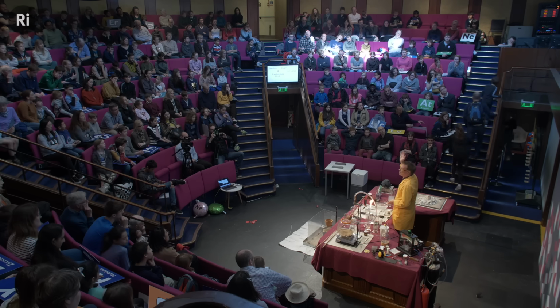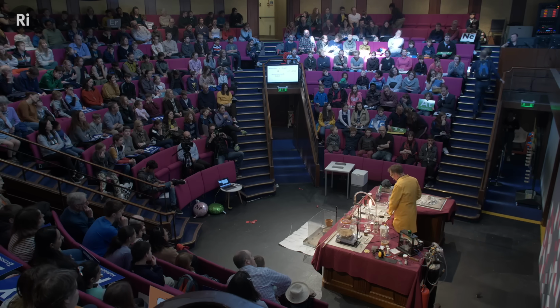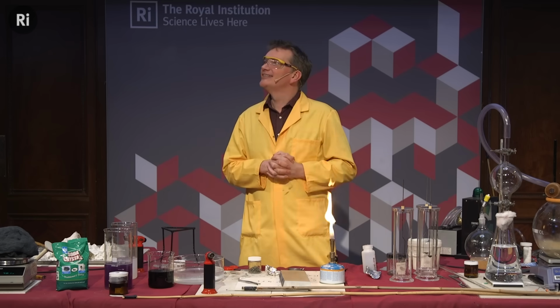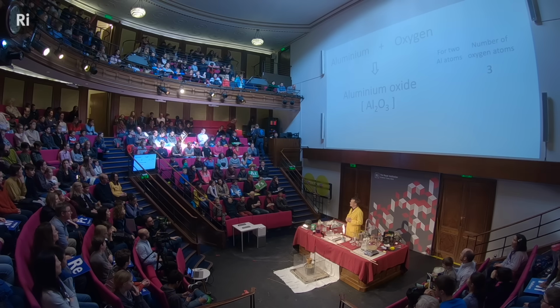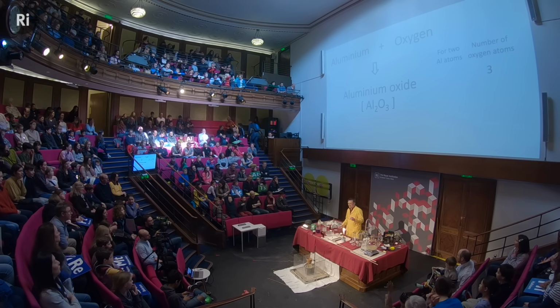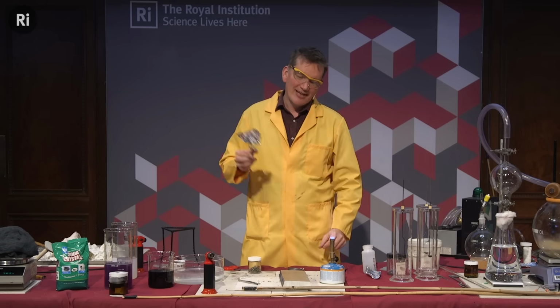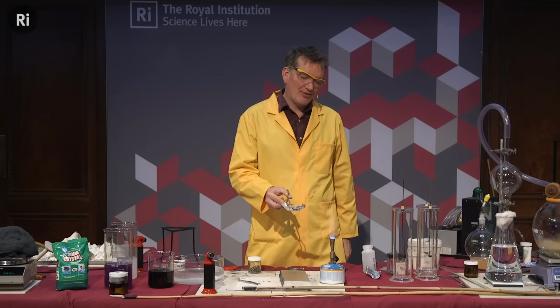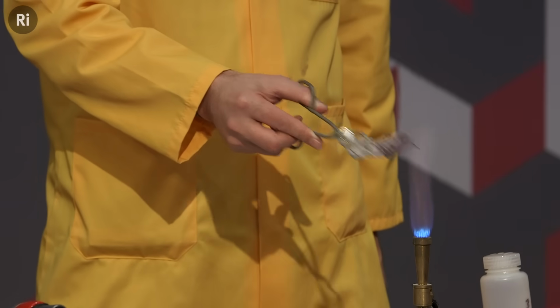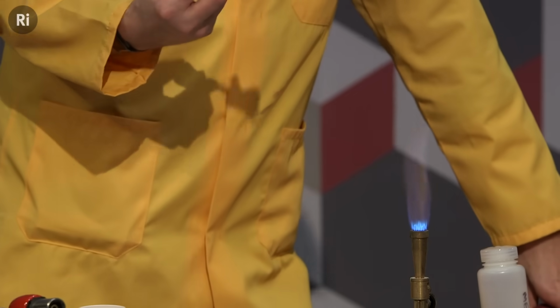So we have boron at the top, and underneath boron we have aluminium. Can we do the same thing with aluminium? So I have some aluminium. Now, who thinks the aluminium is going to burn very easily? Who thinks it's not going to burn very easily? Well, let's try. So I have some aluminium foil. Well, of course, it doesn't burst into flames. We wrap our turkeys with this when we put them into the oven. Well, I don't because I'm vegetarian, but anyway. But it doesn't burn.